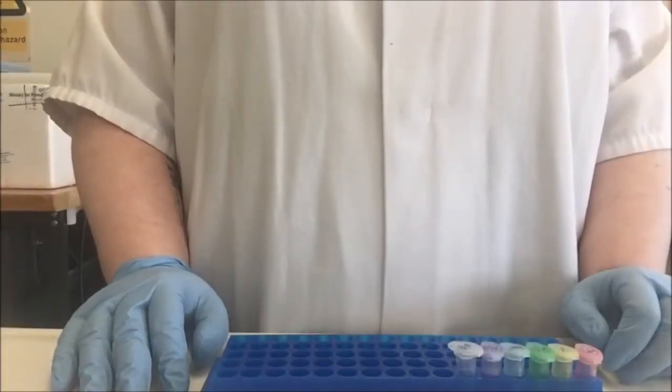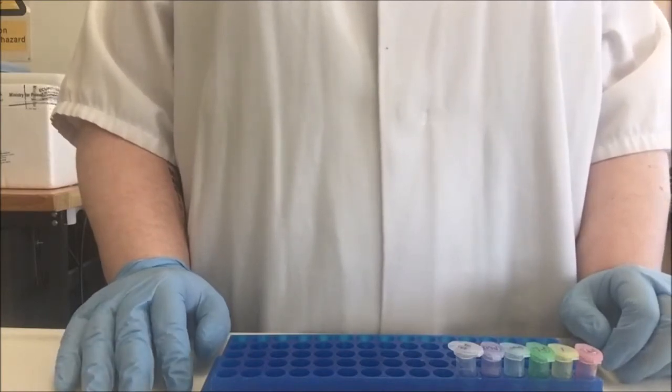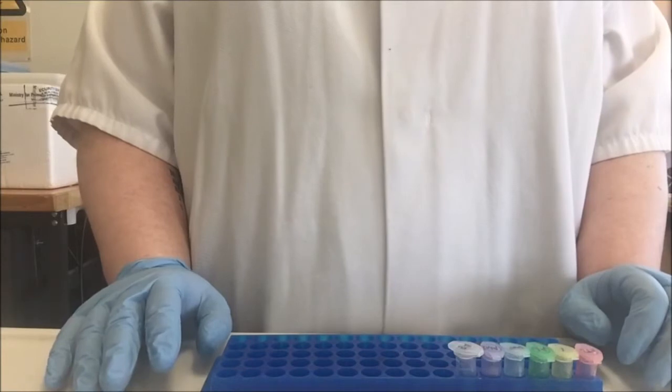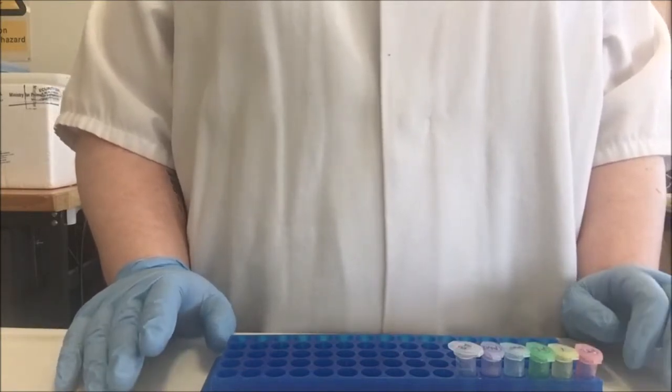I'm going to do a DNA extraction from a buccal swab using a Qiagen blood and tissue kit. This is a kit that is designed for DNA extraction and can be modified for extracting DNA from different types of tissue.